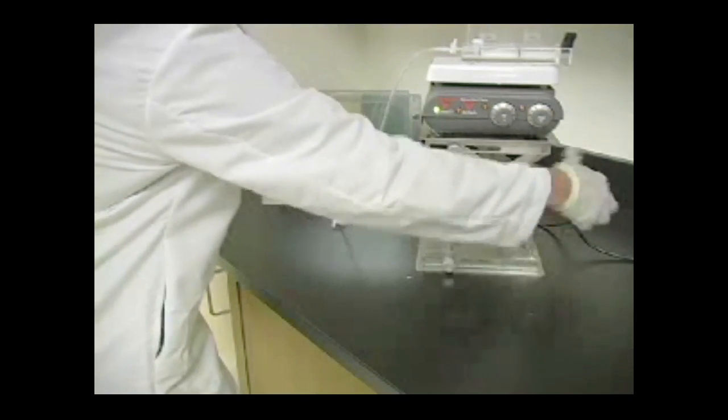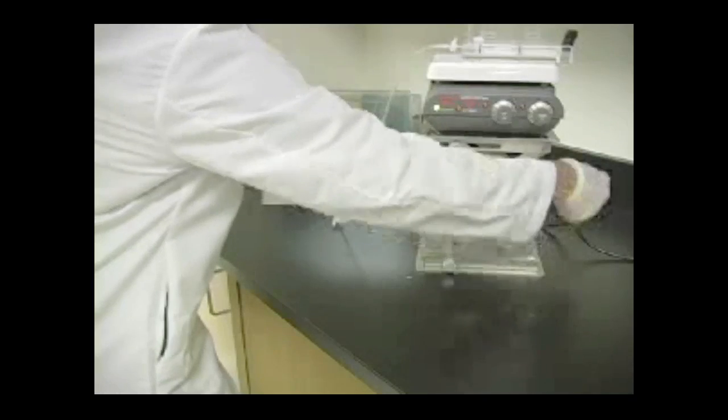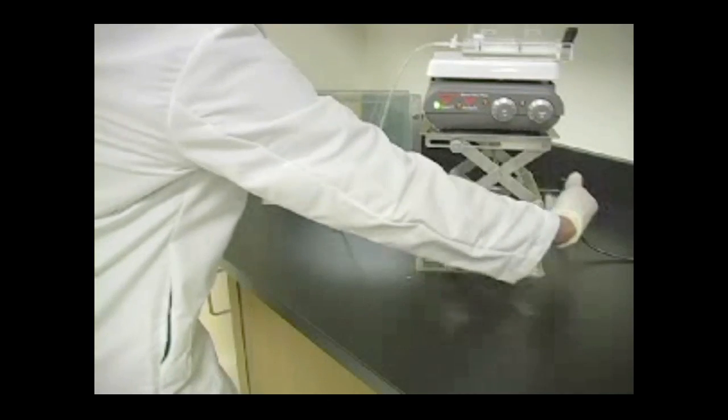This creates a hydrostatic head large enough to cast the gels within 10 minutes from the time the initiators are added to the monomer solutions.